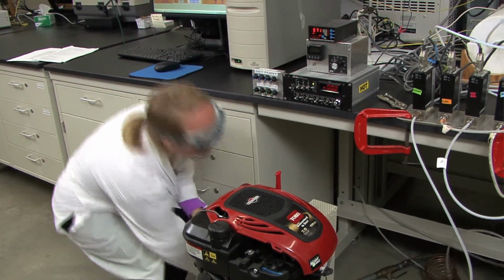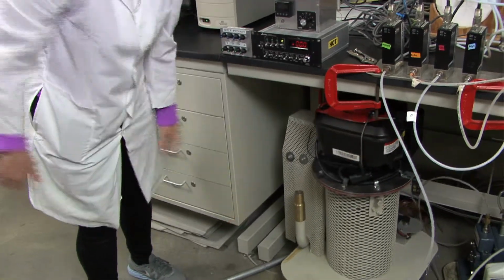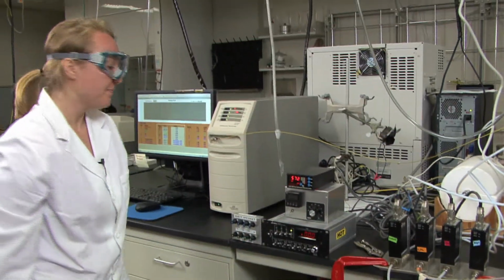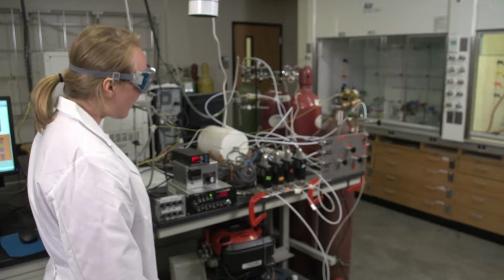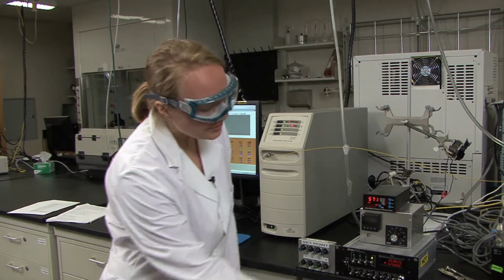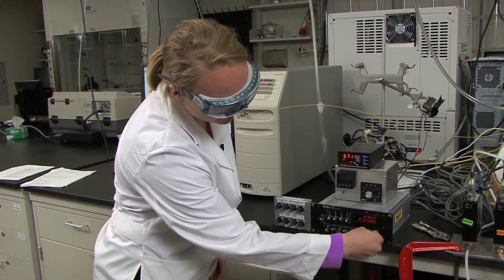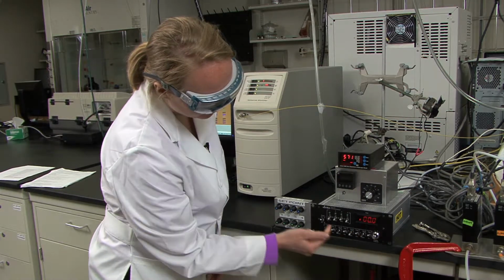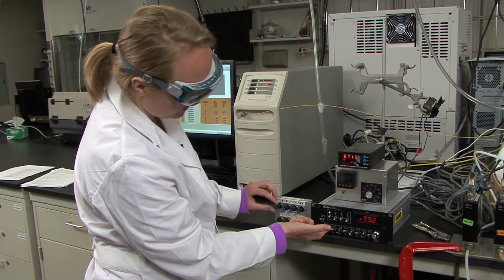And then you can push the lawnmower underneath the lab bench as well. And now we'll need to do a purge on the system, doing argon like we did before. You'll want to turn on the argon so you can start the purge. So you'll need to turn off channel 4 and then move the display dial to channel 1. Flip that on, and then you'll want to make sure that the set point is at 100 SCCM.